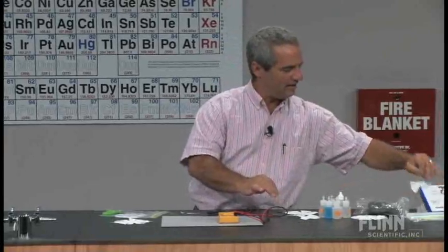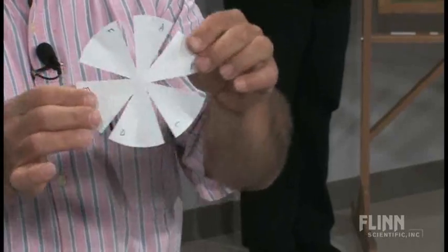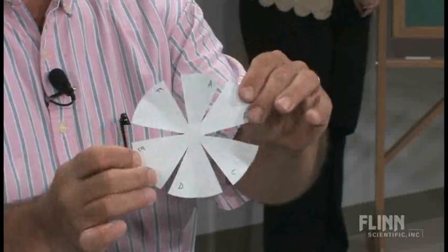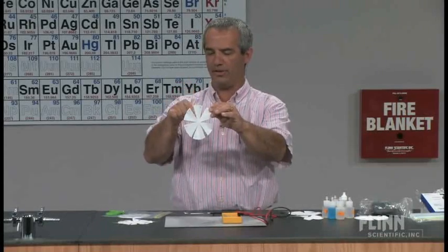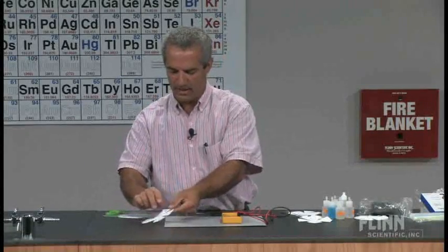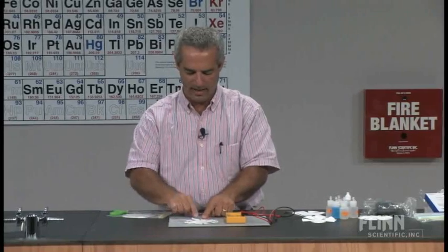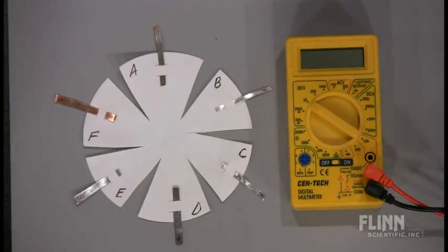You get the little slits there, done in each one of the six petals. When they're done, they'll label them A, B, C, D, E, F with a pencil or marker that's not going to run. Then they slide the metals through those slits, so A gets slid in there and so forth. It looks like this, all shined up and ready to go. I can see my A has even oxidized a little bit since the time I buffed it before I set this up.